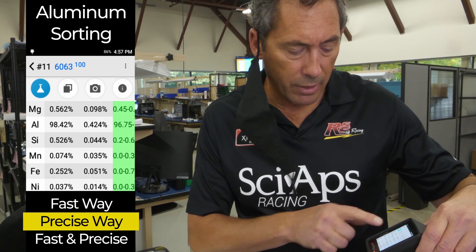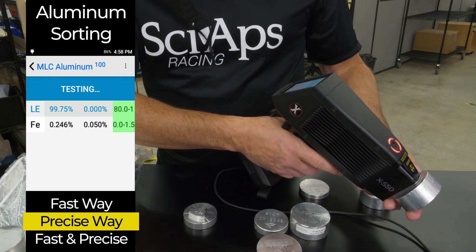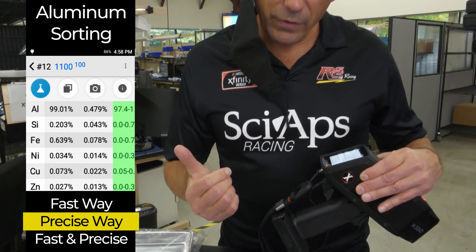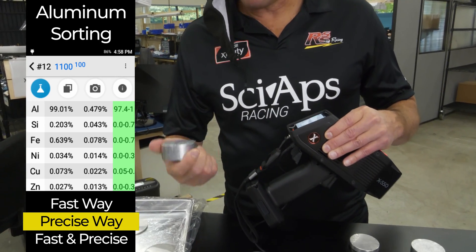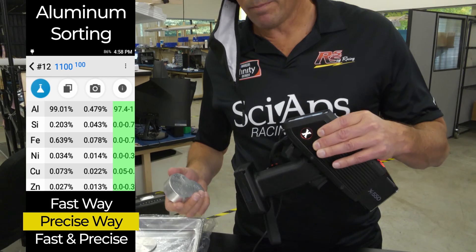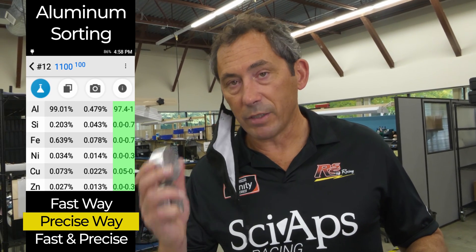We know that's not a 1100, because 1100 does not have 0.5% magnesium. If I shoot my 1100, same thing — it's going to flip over and say 1100, perfect match. Why? Because there's no magnesium measured. In the last video we said some people like to do this the simple way with a single beam shot in about a second. These two — 1100 and 6063 — are the most likely to get mixed up when you do that. If you spend the extra one or two seconds, so maybe a three or four second test total, you can 100% sort these out because you'll measure that magnesium.